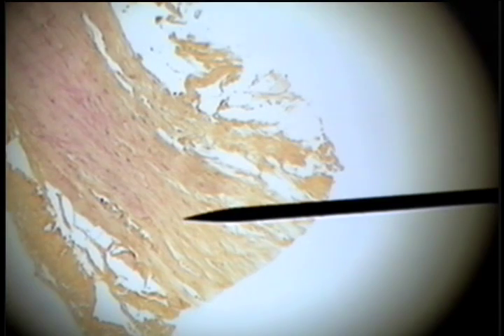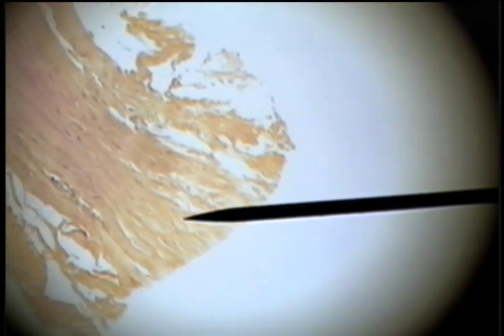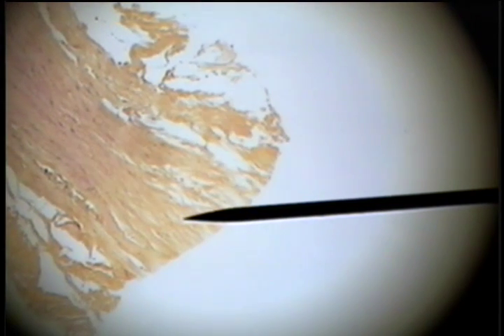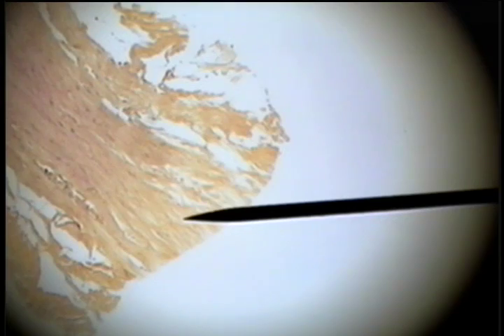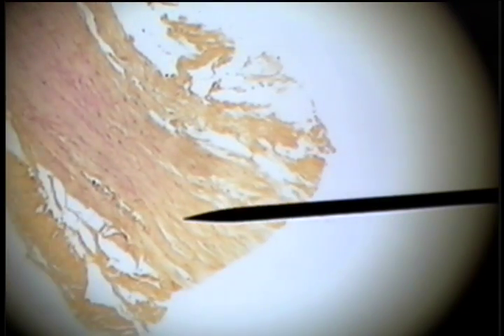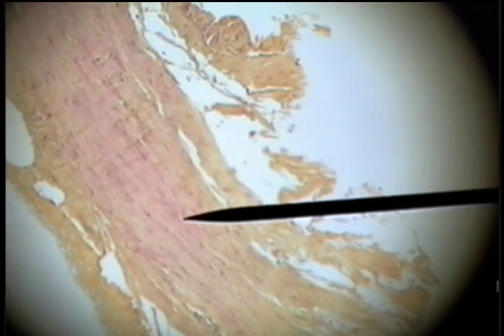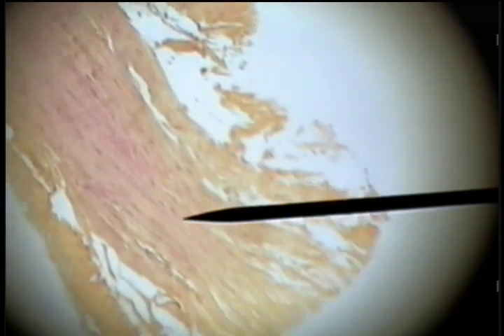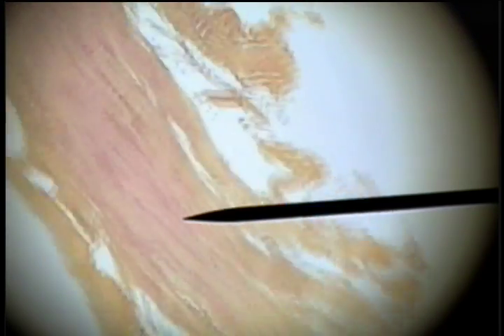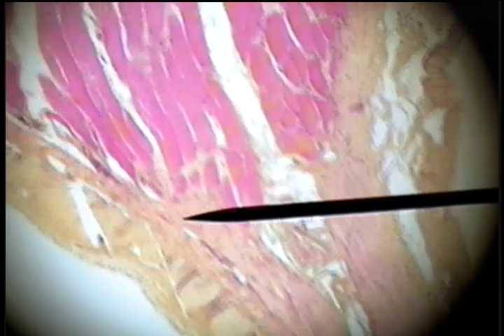It's been teased out and you can see these collagen fibers that make up this dense regular collagenous connective tissue that's associated with attaching a muscle to a bone.